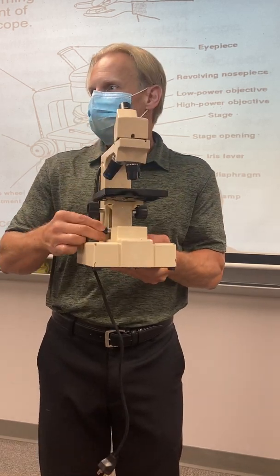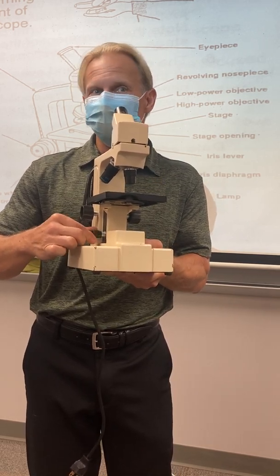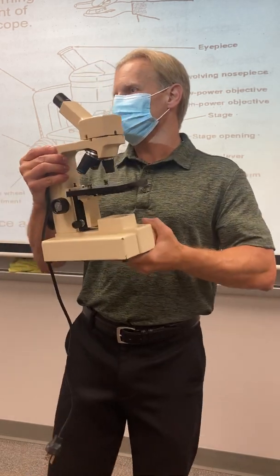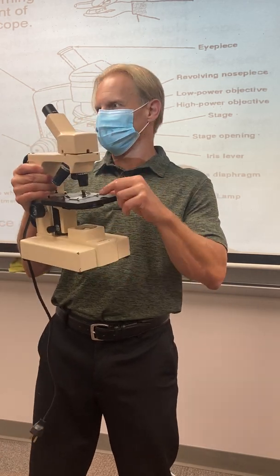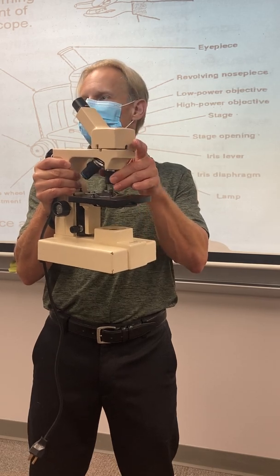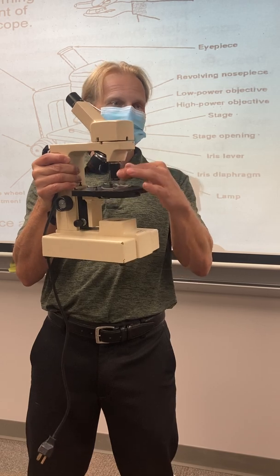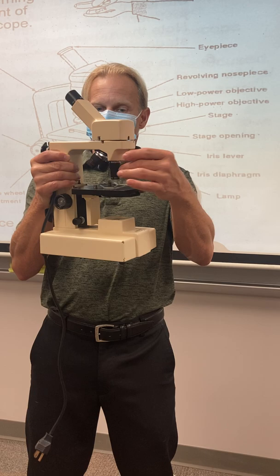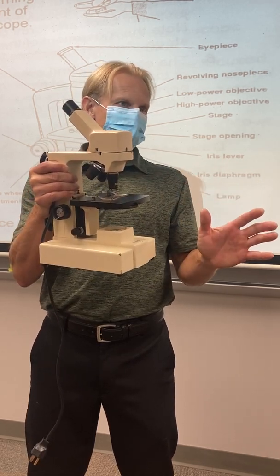Grab that fine adjustment knob, and if it takes more than a little wiggle, something's wrong. It should just be a little wiggle to get it perfect for your eye. Then, the way these scopes are designed, and this is beautiful, if you have it in focus on low power, all you have to do is turn the nose piece to the next highest power. Don't jump up to the highest power. In this one, I'm getting the middle power. That was the 10 times, so I'm at 100 power now. Turn it to this one, and without doing anything, it should be almost perfectly in focus.